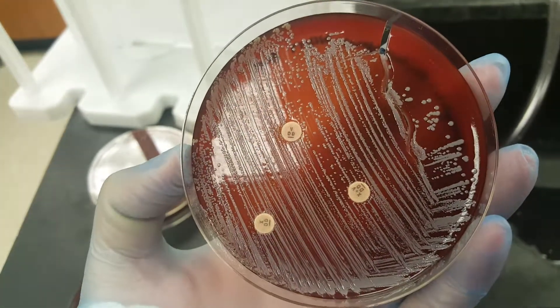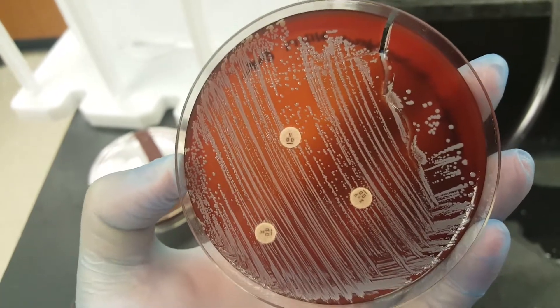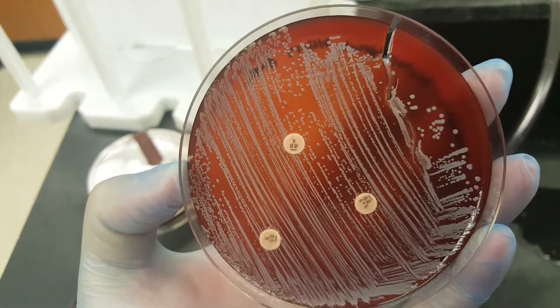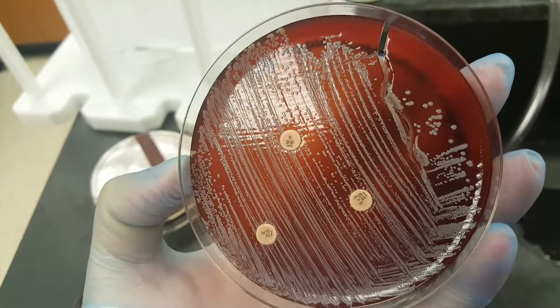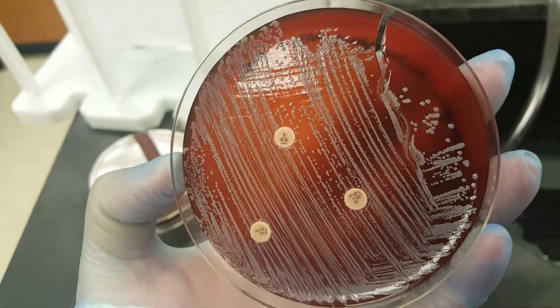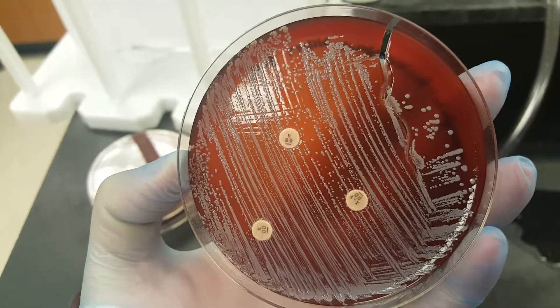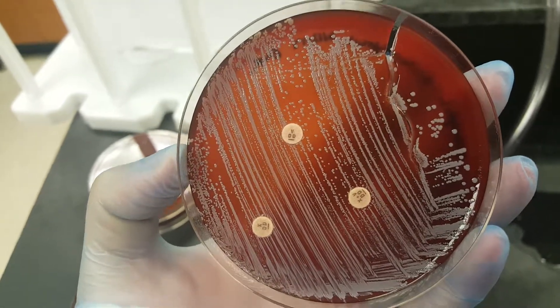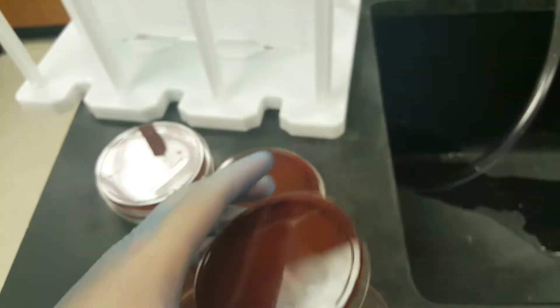This is also what your plate will look like if you accidentally dig into it. It'll cause a big rip down the middle, or wherever it is that you dug, and you'll get a result like this.